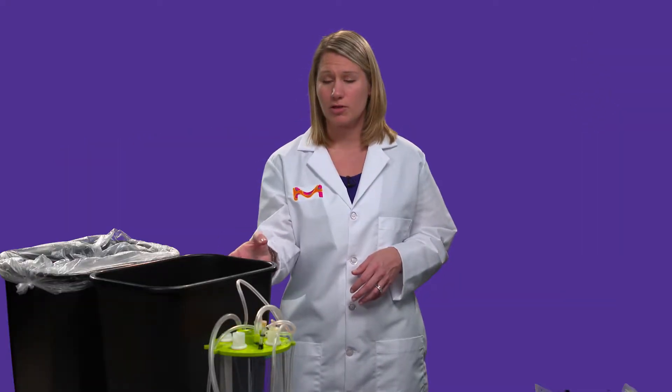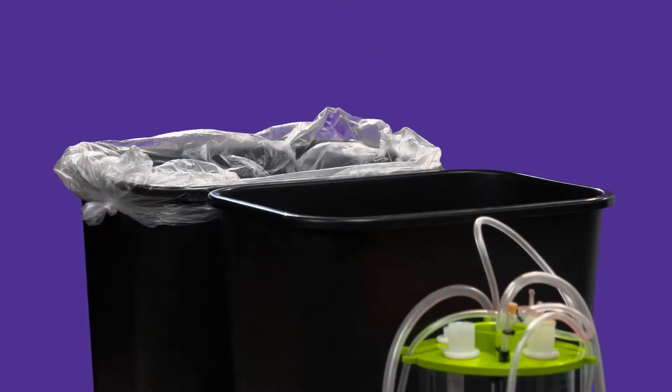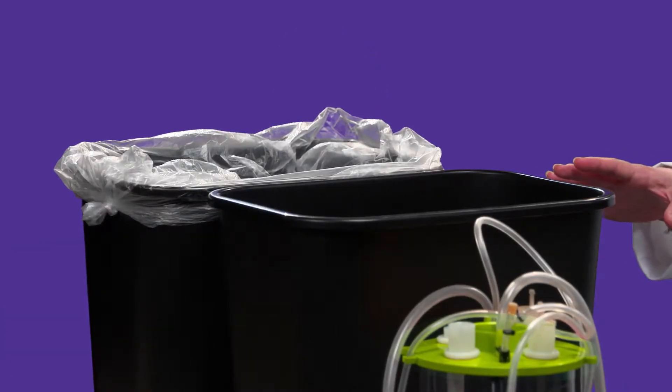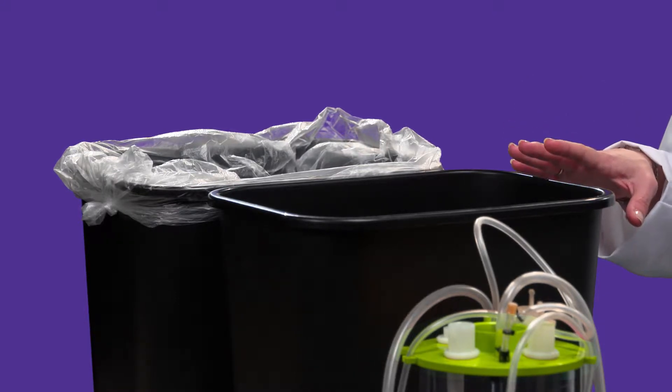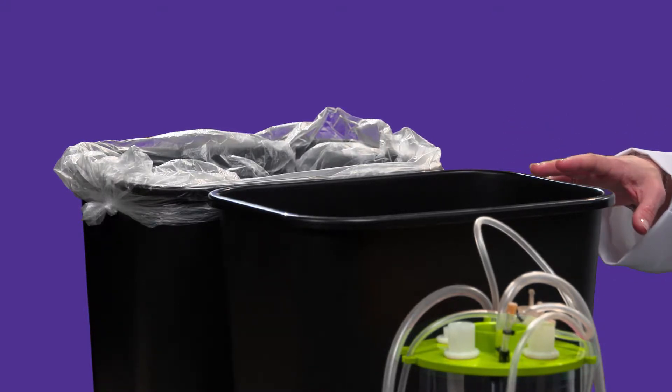Say you forget to put the garbage bag in your garbage. When this gets filled up, you now have to take it out. Now the garbage can is quite dirty inside. You don't want to bring that back into your house until you've cleaned it up — you don't want to bring that contamination risk back. In order to clean this, I need a water source, I may need some soap, and I need to take the time to clean this out before I bring it back into my house and start refilling it with new garbage.